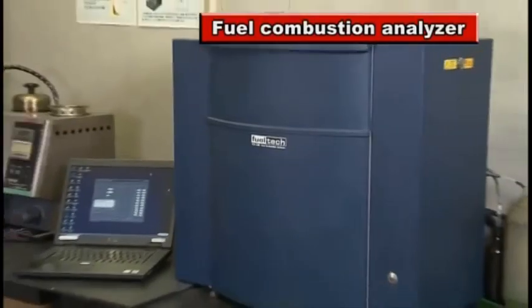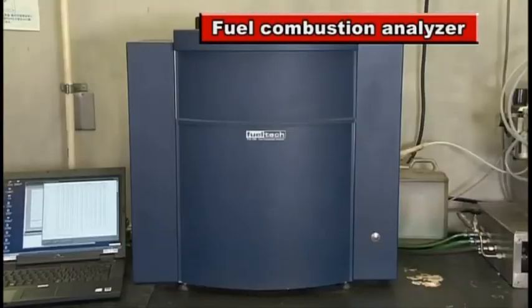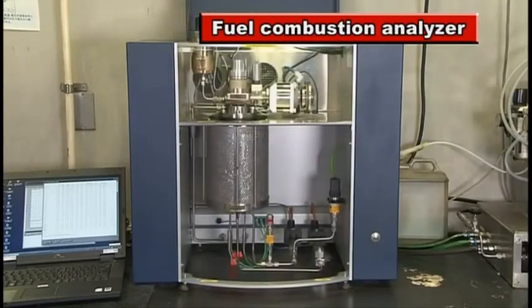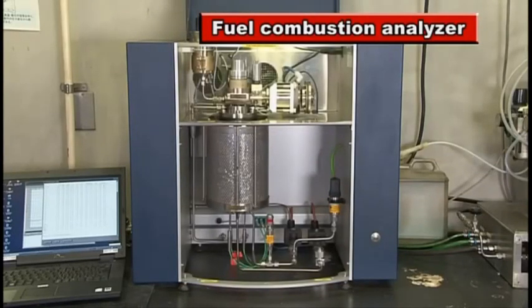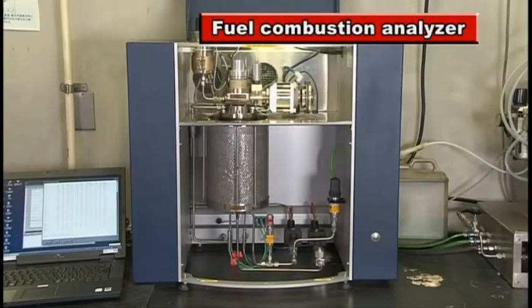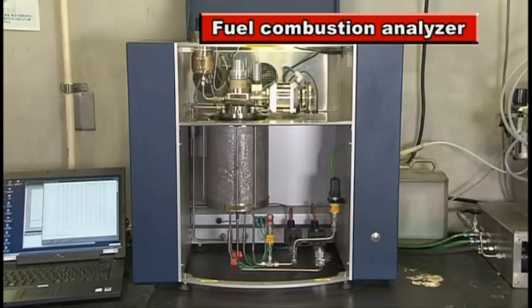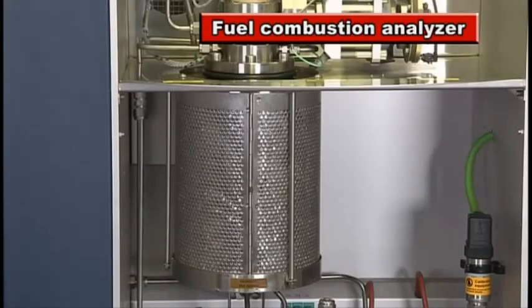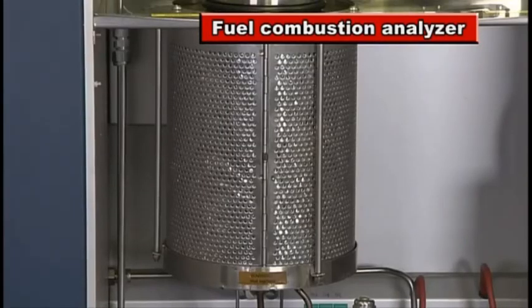The fuel combustion analyzer analyzes the combustion properties of fuel under various conditions by setting the pressure and temperature in the combustion chamber arbitrarily. Contrary to actual engines, this analyzer allows precise recording of fuel combustion properties without mechanical influences such as the motion of the piston.